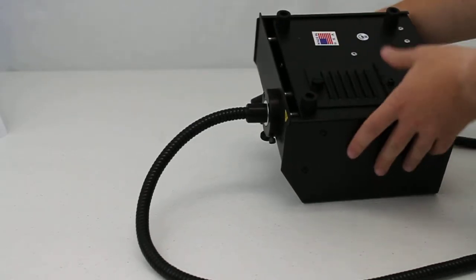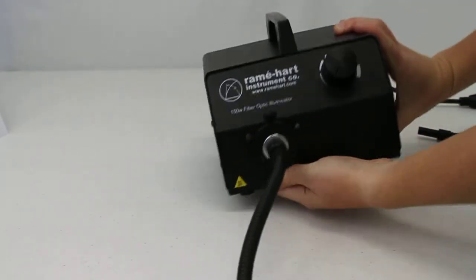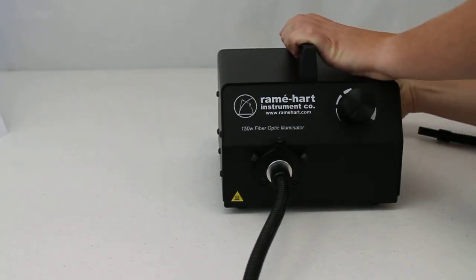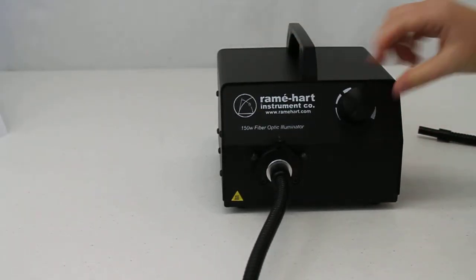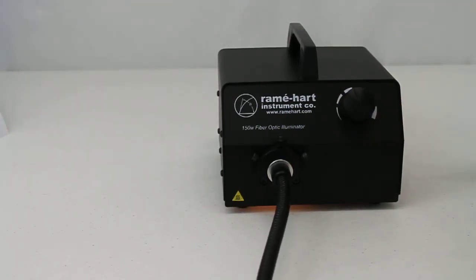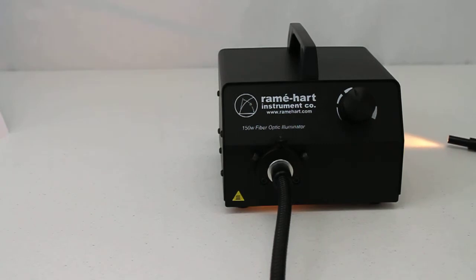Turn the unit right side up and then plug it in. Turn the power on and check for illumination. This concludes this demonstration video.